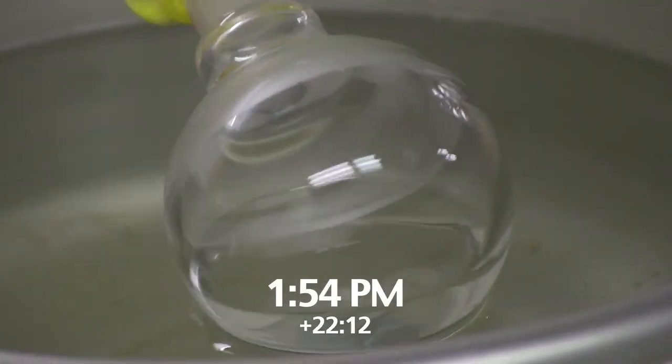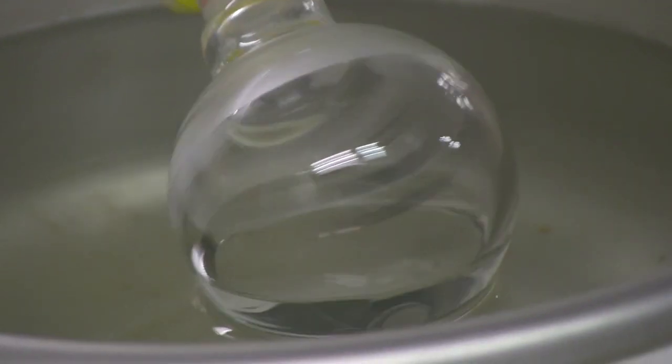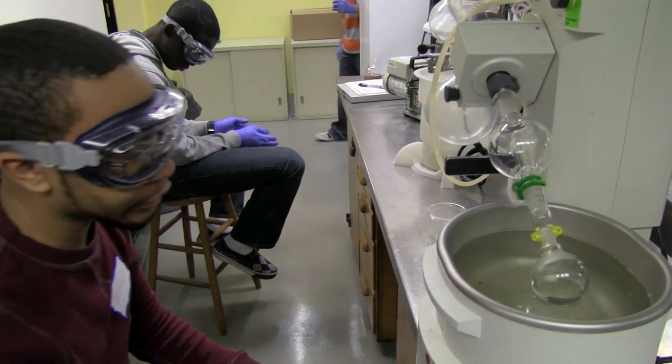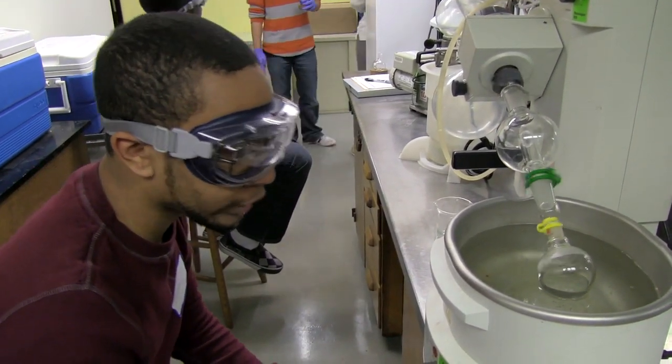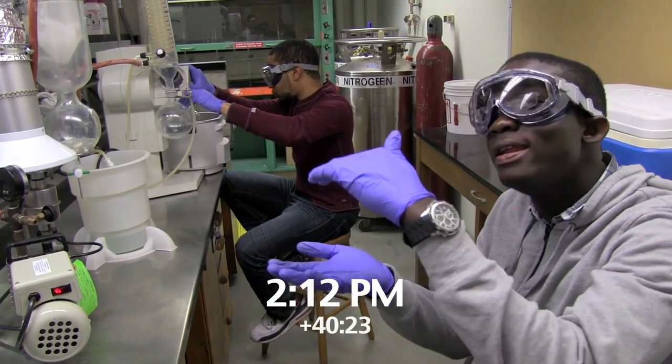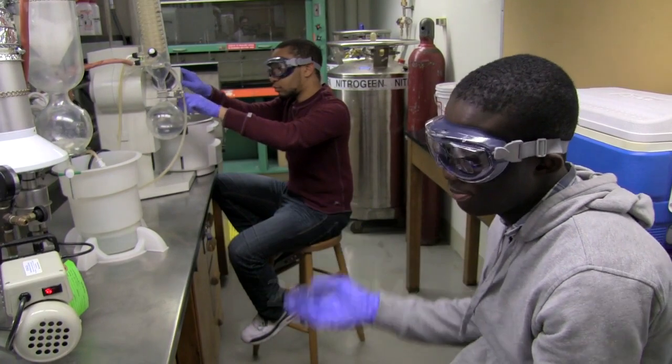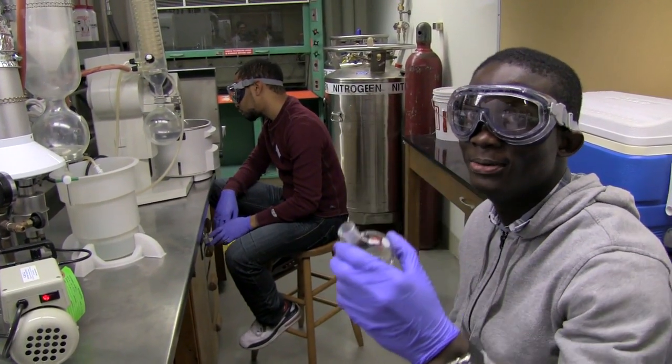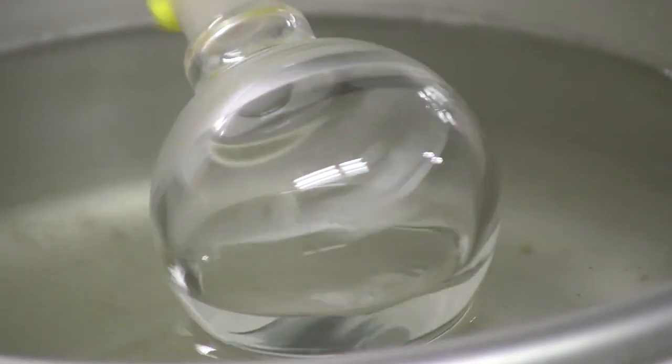I'm not getting any of my dry sample on the edges. I think as long as there's still ether in there, then I won't get anything to show up, is what I'm hoping. His was a lot and it's not succeeding. Mine is little, so what chance will I have?